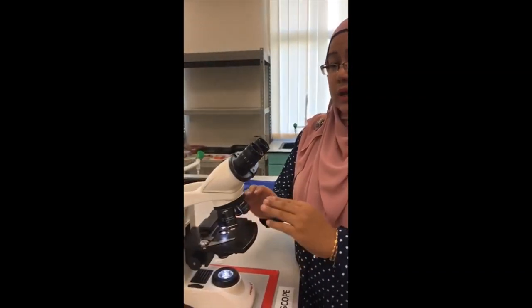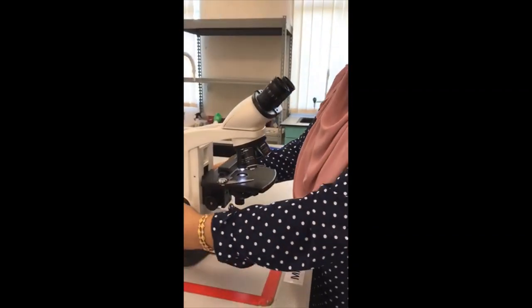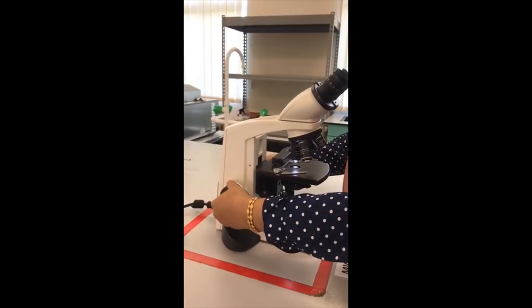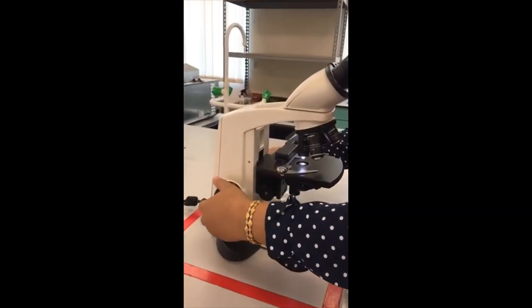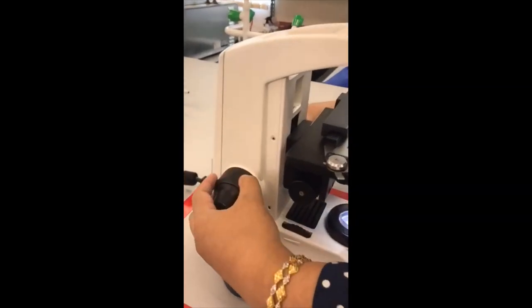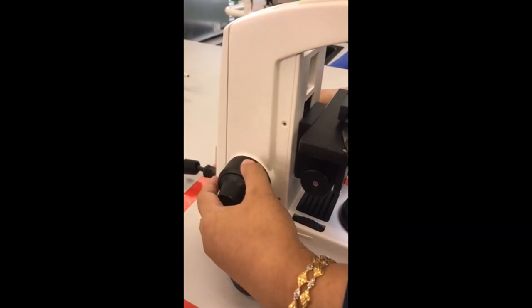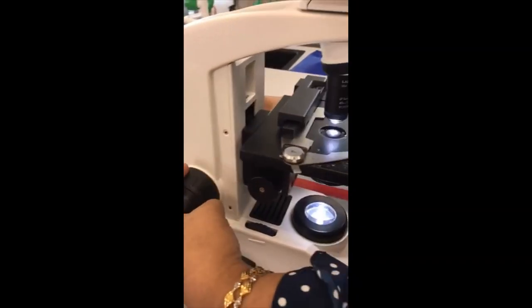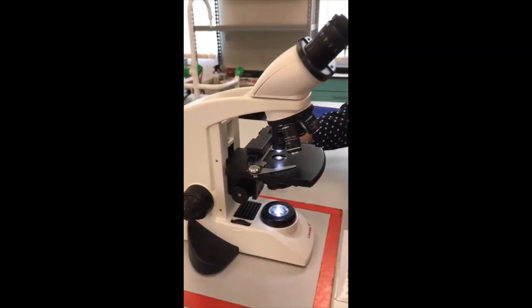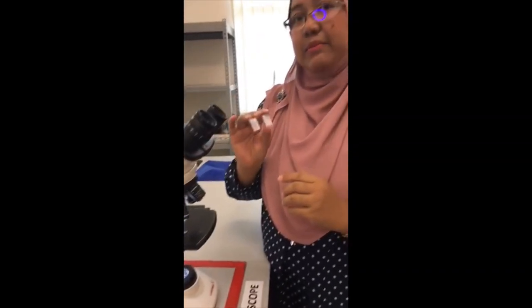I will lower the stage down — to do that I use the coarse or fine knob. I will lower it and then place my sample.